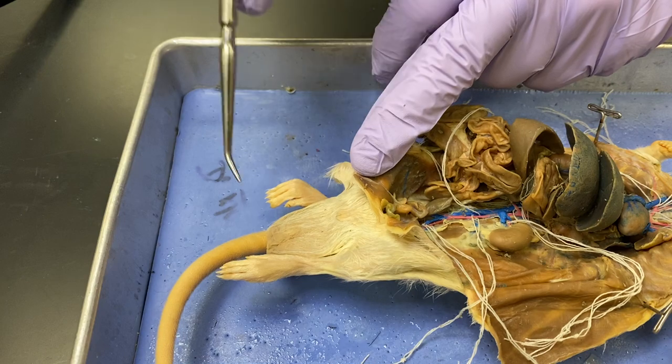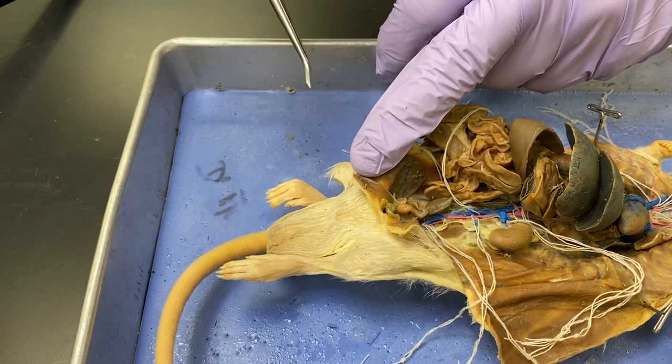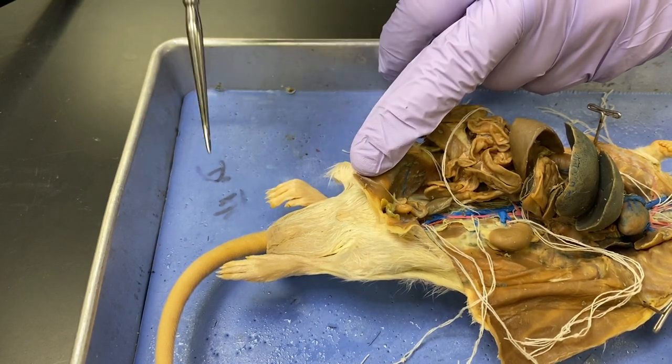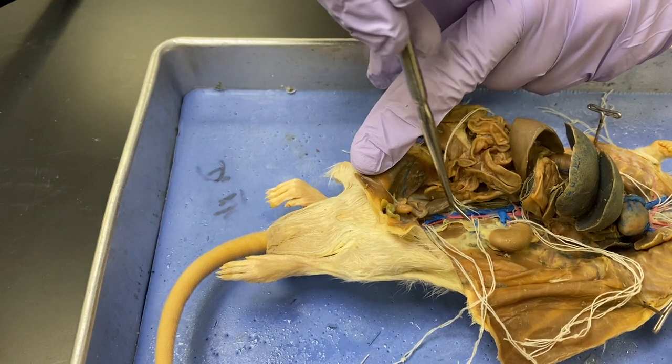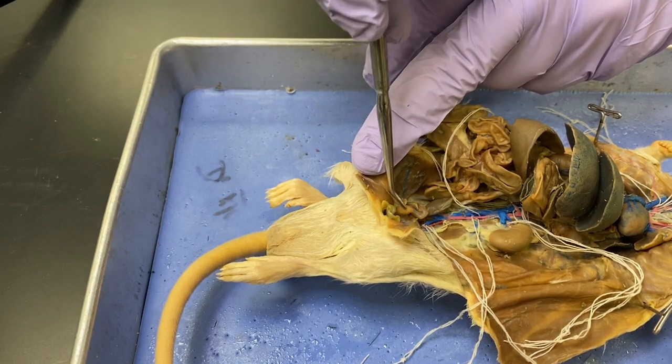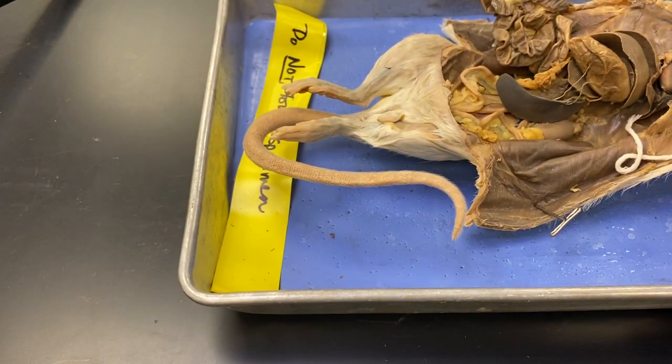Now I'm not going to show you the urethra or the urethral opening on this, so forget it. Just these three parts — kidney, ureter, bladder. I'm going to switch out with a female rat, not that they have different urinary systems, just to give you another view.